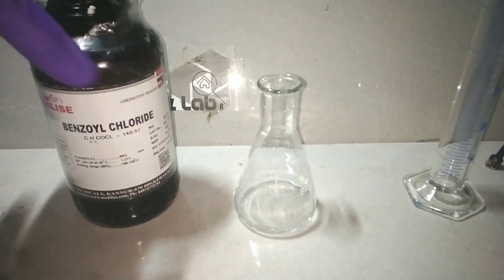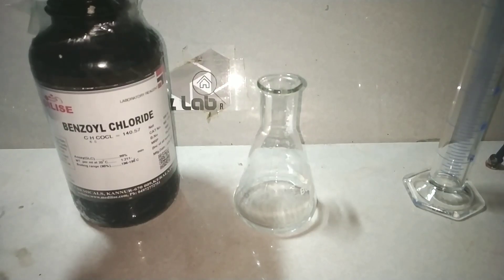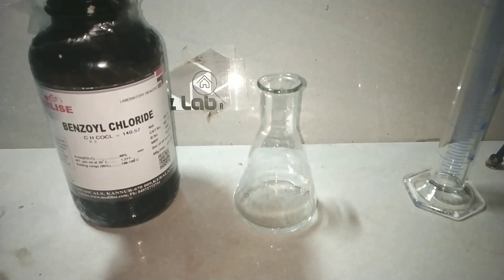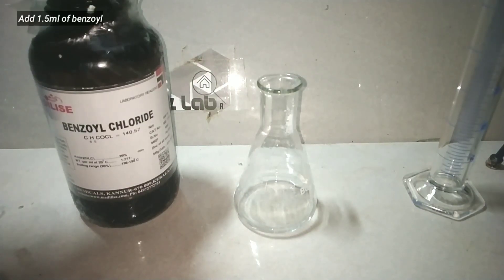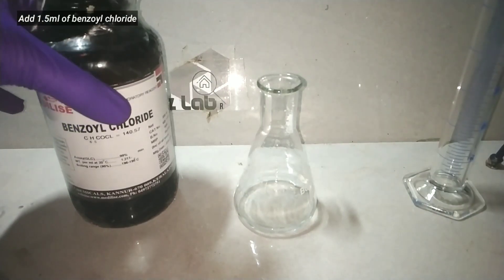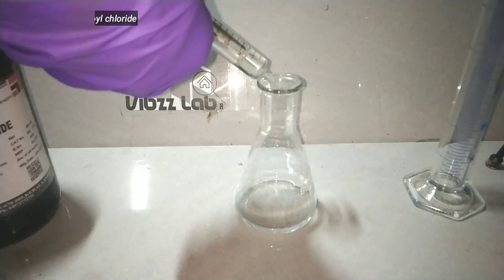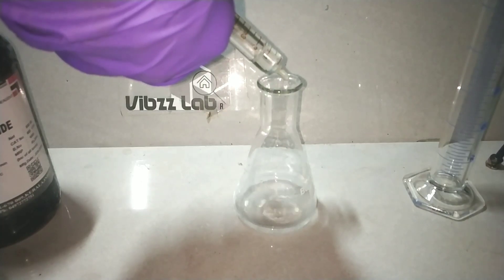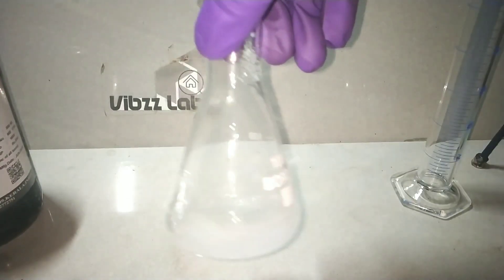Now we have to add the benzoyl chloride. Benzoyl chloride as you know is extremely irritating to the nose, throat, and eyes. So do this in a fume hood or outside in a well-ventilated area. I am using a glass syringe to transfer exactly 1.5 ml of benzoyl chloride into the Erlenmeyer flask containing our glycine. The flask gets very hot on addition of the benzoyl chloride.